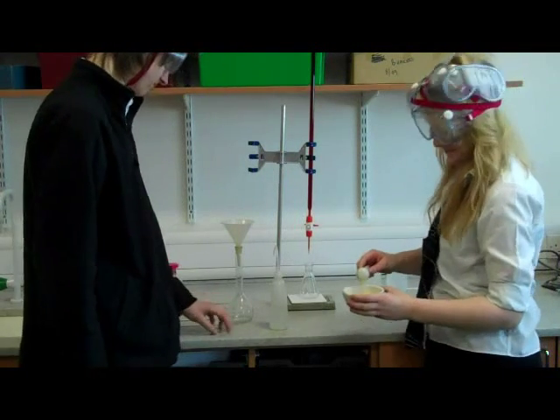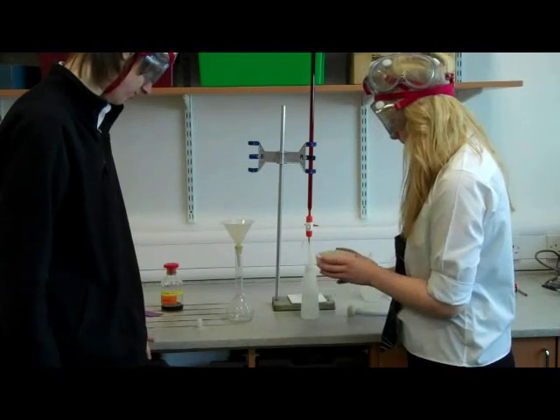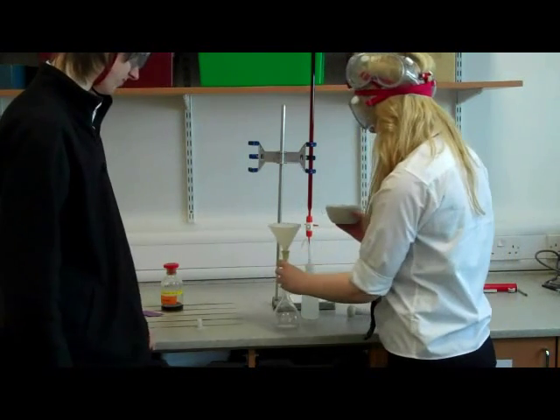Step 3. Add to a 250ml standard flask. Fill with deionized water to the 250ml line.